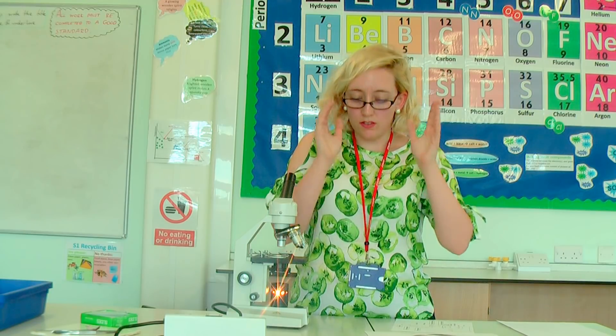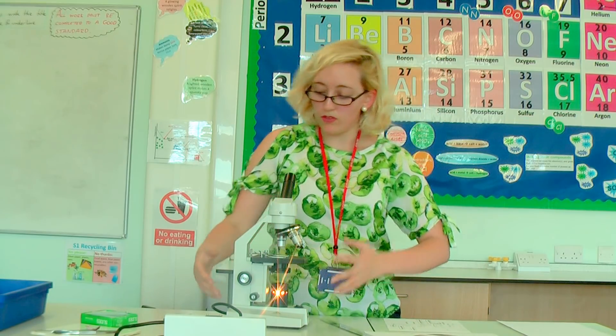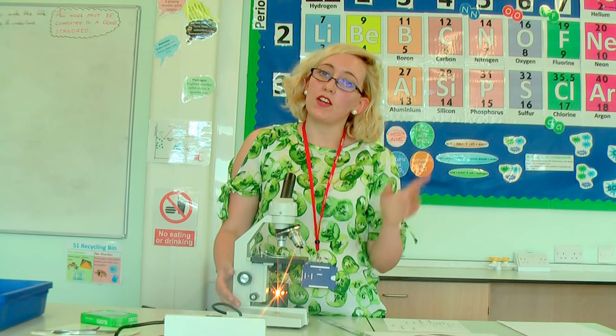So that's a couple of calculations for you. Super simple practical: make your onion cell slide, put it on the microscope, remember all the parts of the microscope and how to focus it, then draw your cells, calculate the length of one cell, and then calculate your scale bar. That's pretty much it for the AQA required practical for biology on microscopes. Thank you very much.